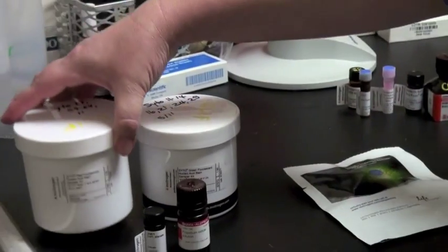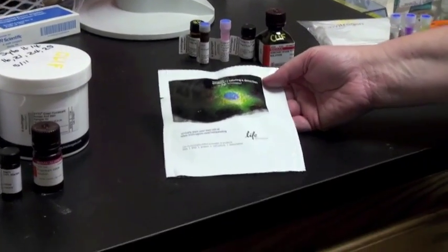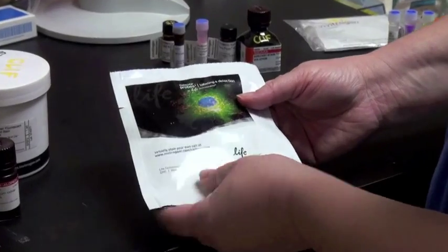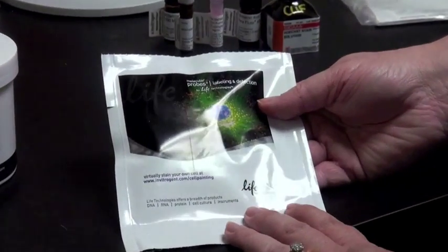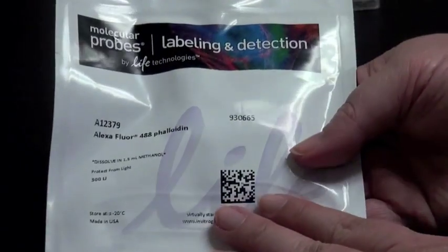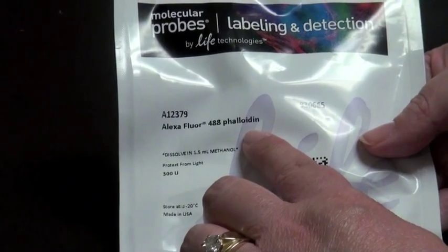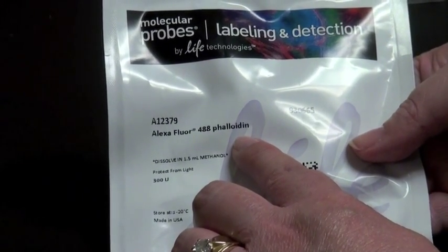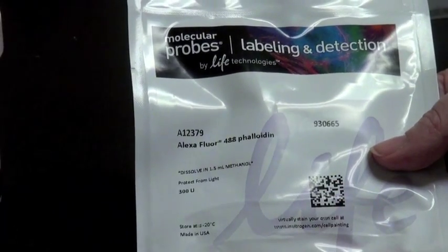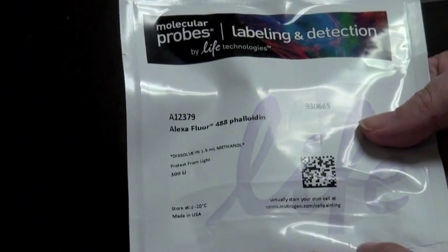Next, there are a number of other organelle stains that are wonderful for fluorescent microscopy. For example, this is a package from Life Technologies of 488 phalloidin — it's a Alexa Fluor 488, meaning it's a green-labeled phalloidin. Phalloidin is a fungal toxin that binds to the sides of filamentous actin and freezes the actin cytoskeleton in place. It's a wonderful co-stain to give you an idea of where things are located within the cell and gives you the architecture of the cell.